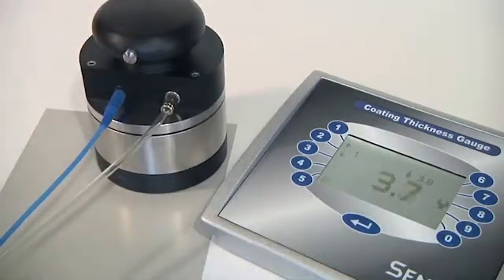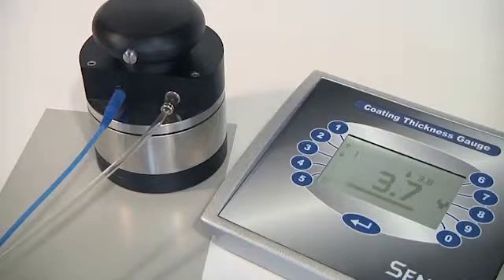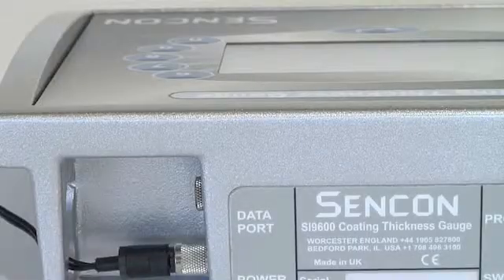Up to a thousand results are stored in the gauge, or they can be sent to a computer via the gauge's serial interface.